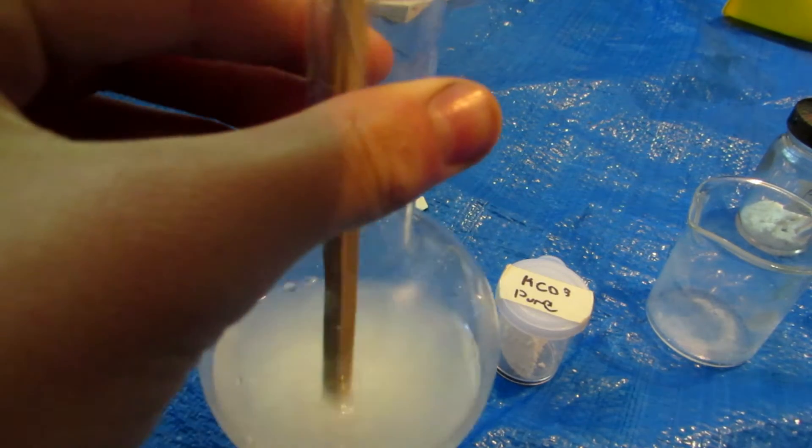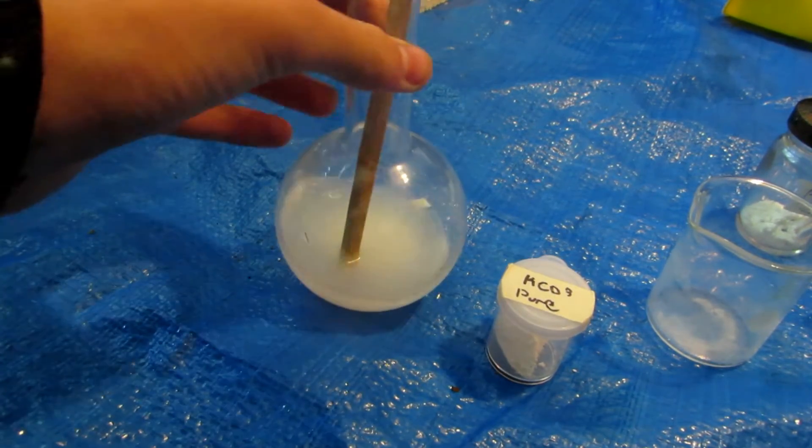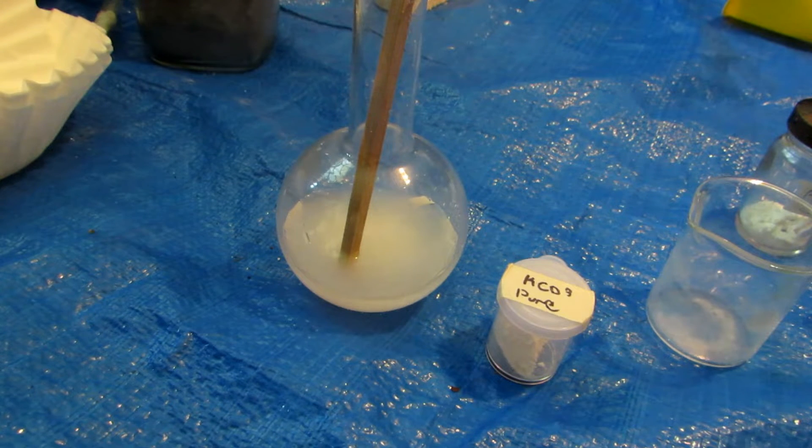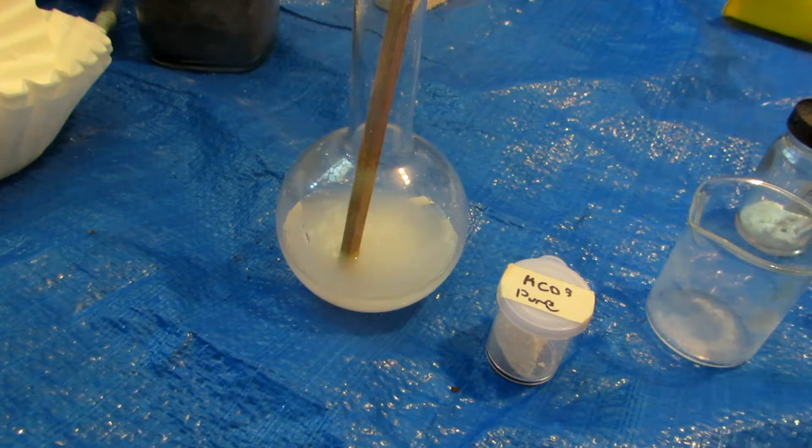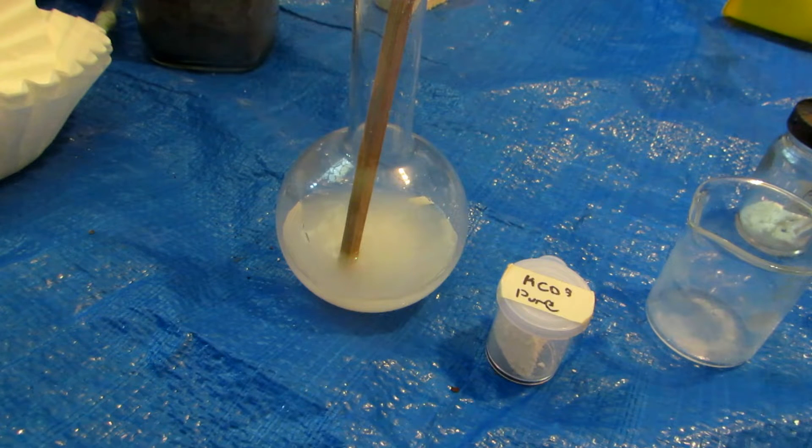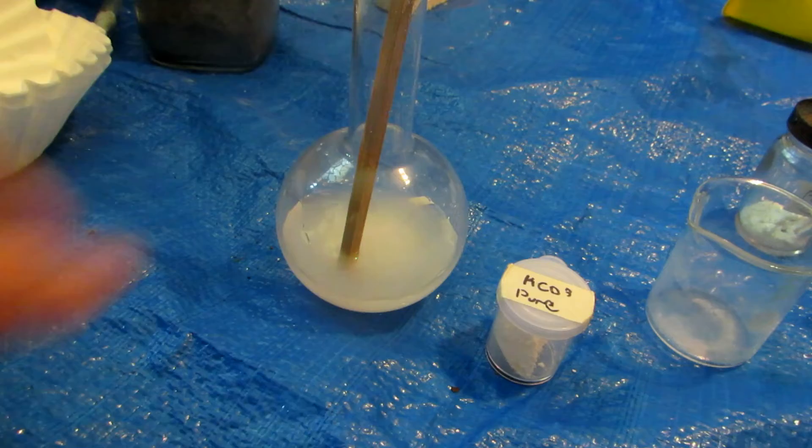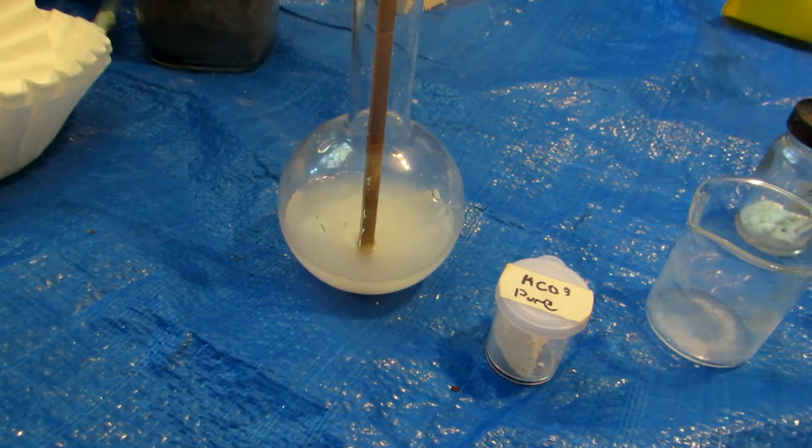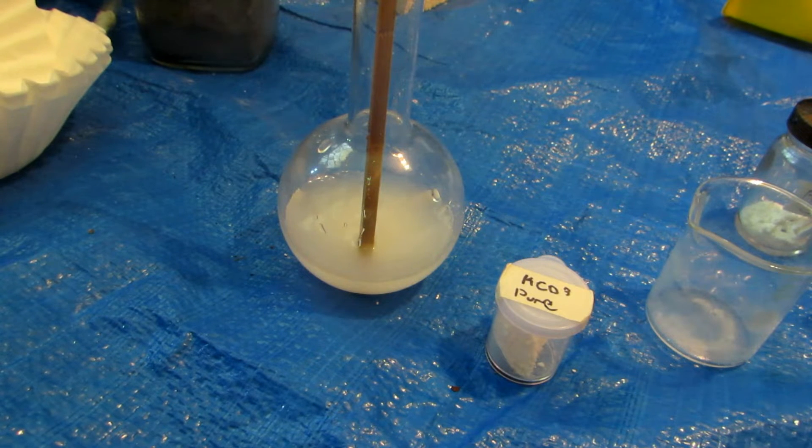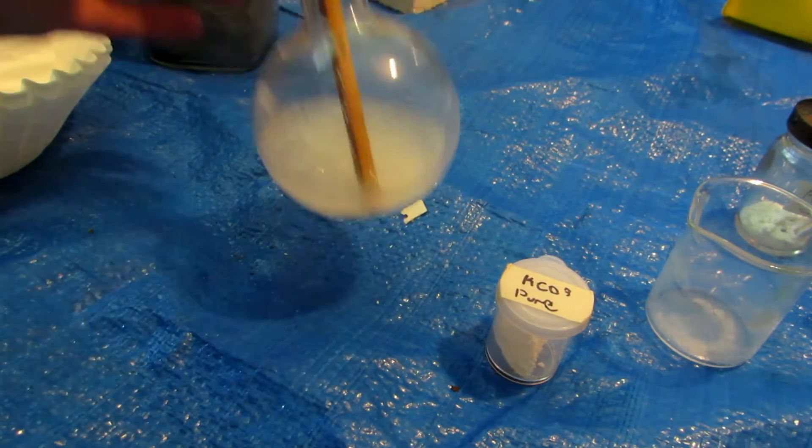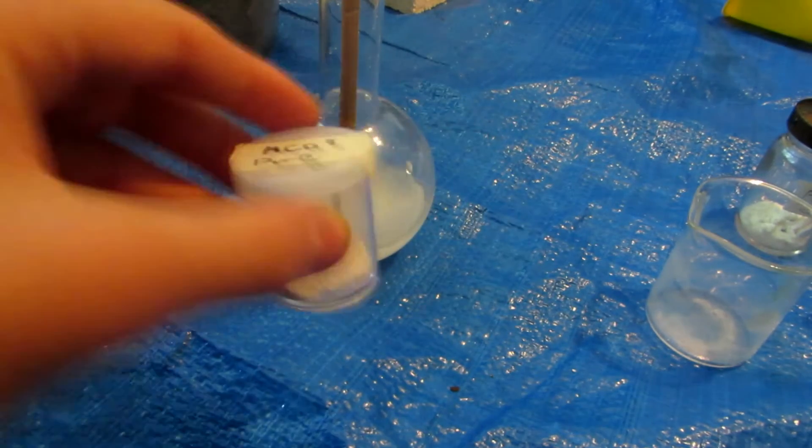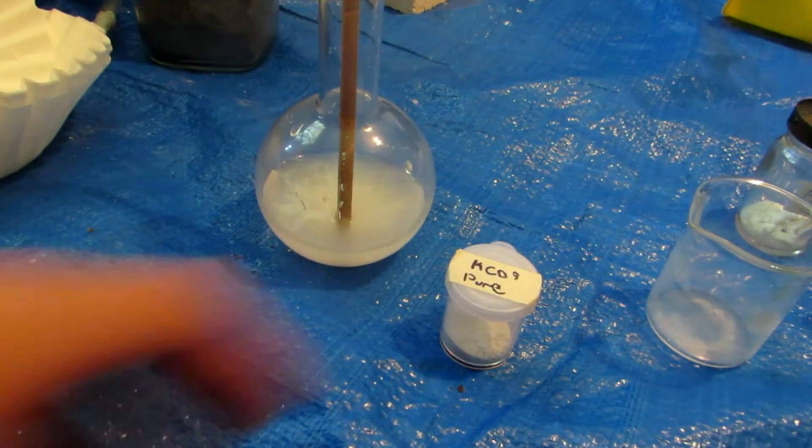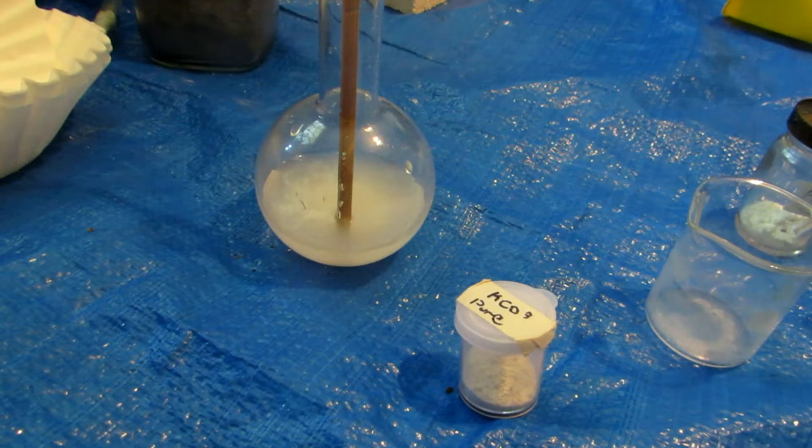Okay, so I put it in and I used a chopstick to mush it up so that it would break apart and dissolve easier. Now calcium hydroxide only dissolves 0.2 grams in about 100 milliliters of water at 0 degrees Celsius. And as the temperature increases, the solubility decreases. We also have to use distilled water because any basic solutions rapidly decrease the solubility of calcium hydroxide. Anyhow, what we formed here as you can see is a suspension. So what I've done is I mushed it up really fine so that it would hopefully dissolve a bunch, but we formed a suspension which is known as milk of lime. Anyhow, this will hopefully also work because the more calcium hydroxide we have, the more we'll react with our potassium carbonate here. The reason I don't really like this method and the method I'll be showing in the future is more efficient is because it's so difficult to get enough calcium hydroxide to dissolve to do this on any reasonable scale.